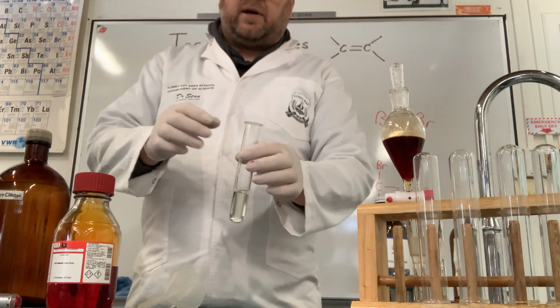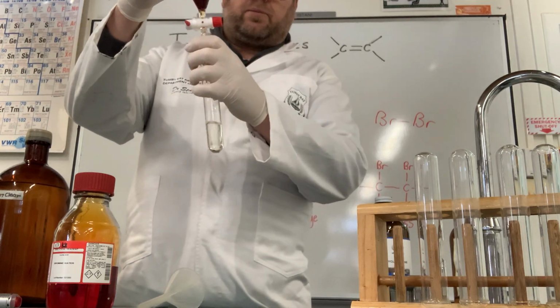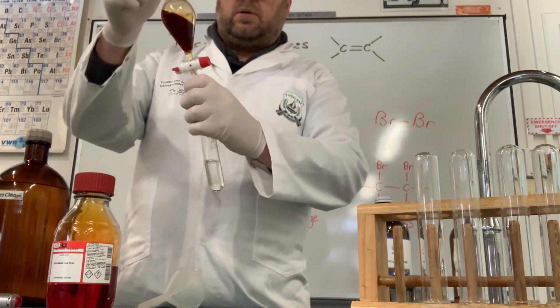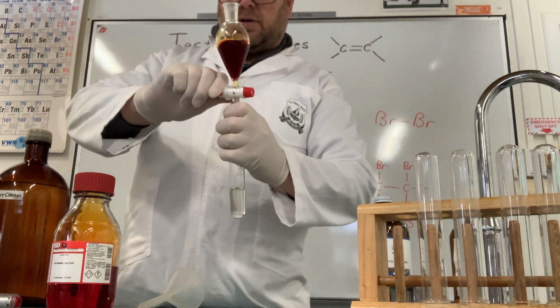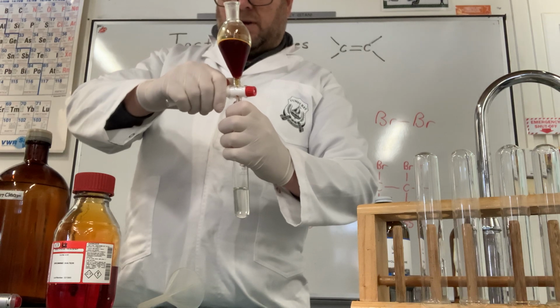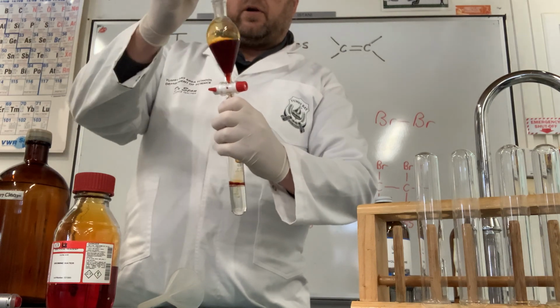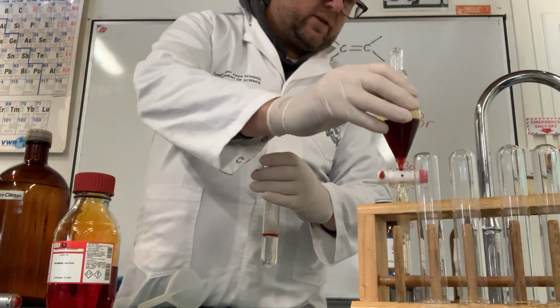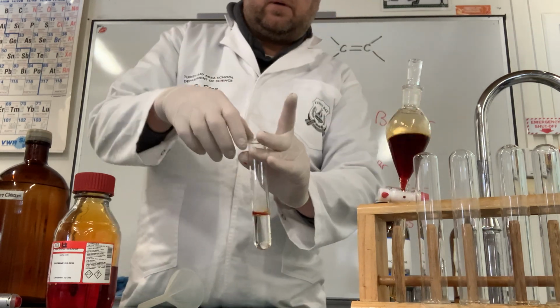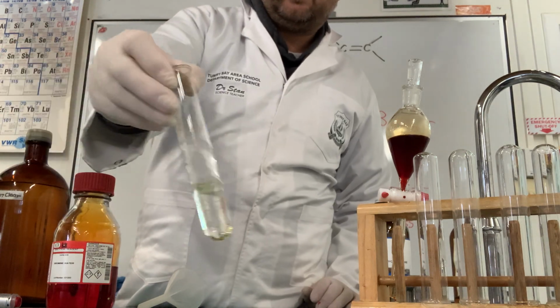and then to that olive oil, we are going to add some of our bromine solution. Just a few drops. Just going to take the top out so it doesn't suck. And then we just add a little bit. And when we add it, we should see that orange colour. Hopefully I haven't added too much. You can see that orange colour that's sitting on top. But then when I stir this in, that orange colour should disappear.